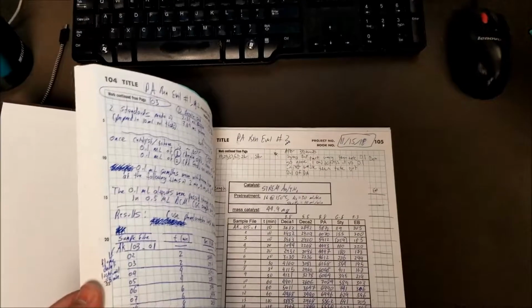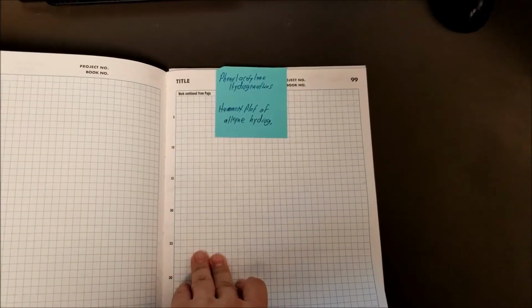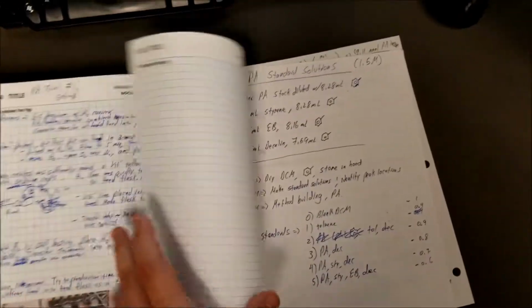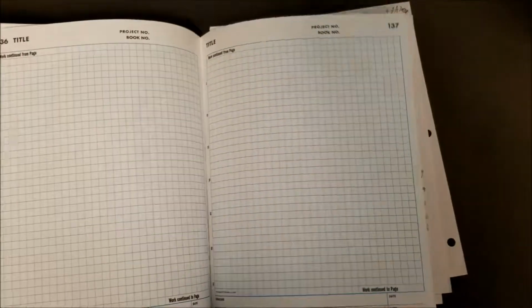And then finally, we have Aaron's notebook. This would be the binding label here. And Aaron's notebook contains data on the phenylacetylene hydrogenations that we were trying to work through last winter, the winter of 2018. So if you start at page 99, I had him separate his notebook in two because I was doing some of these experiments as well, and it goes through some of the method building and some of the initial experiments. I've gone over a lot of this data. Not a lot of it really made sense to me, but if we were to continue with the experiments, we'd obviously go to page 136 on here and go from there.